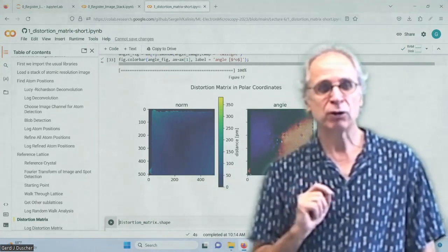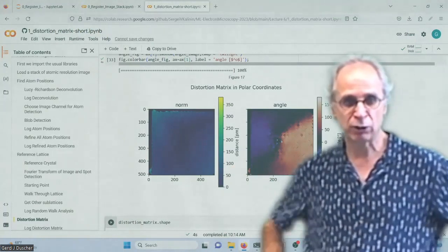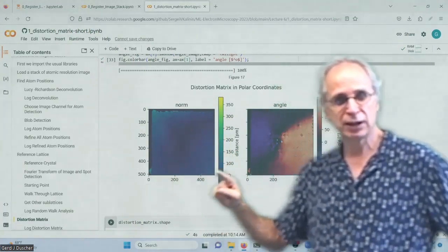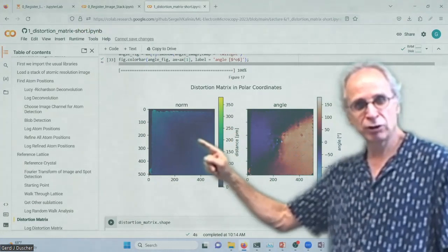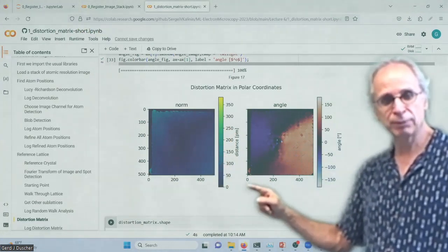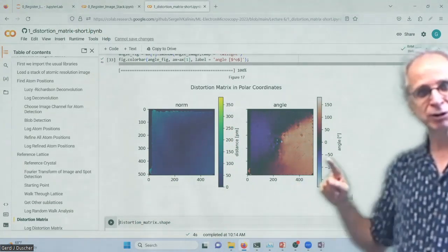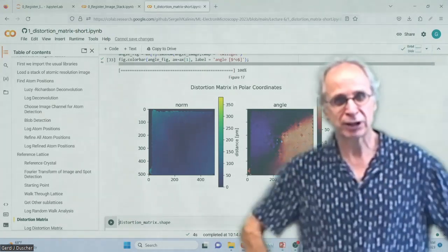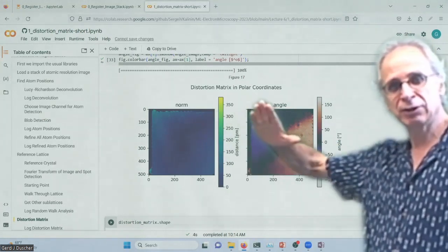And I can determine this for each pixel that I can evaluate, because I have a Voronoi cell. So on the sides, you see, I cannot determine Voronoi cells. And also there is some deformation. So in the center, I have very little deformation, and you see to the bottom right and the top left, here we are. We have more and more deformations as we go along. The deformations go in this direction, so they flip in the middle. And in the middle, of course, because there's very little deformation, which direction it goes is undetermined, but it basically goes in this direction and that. So we have deformation in that direction.